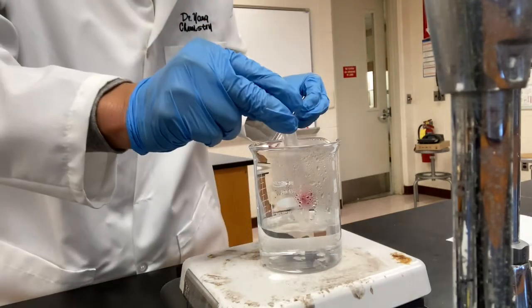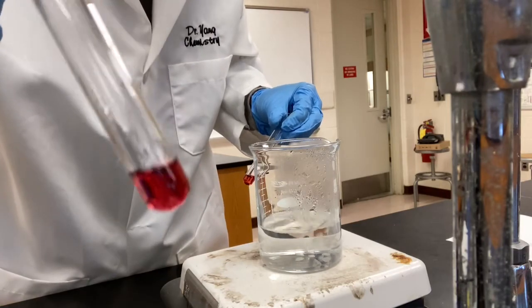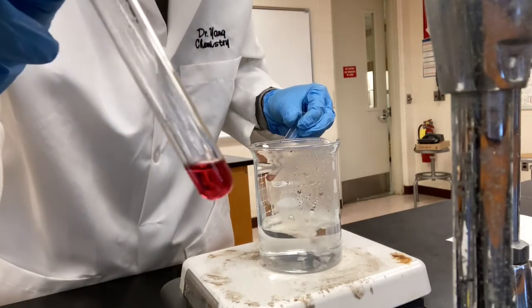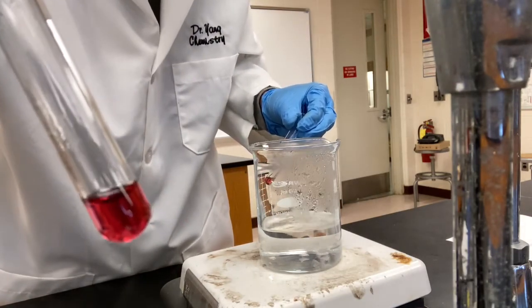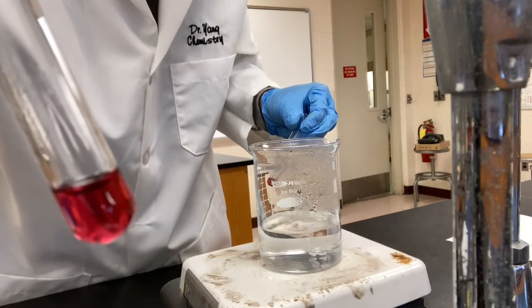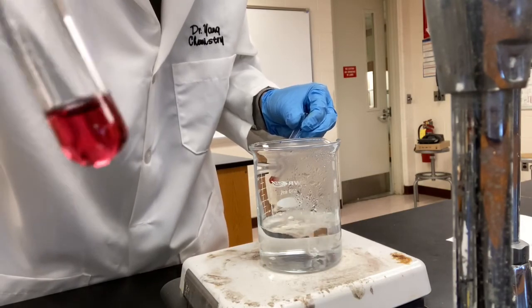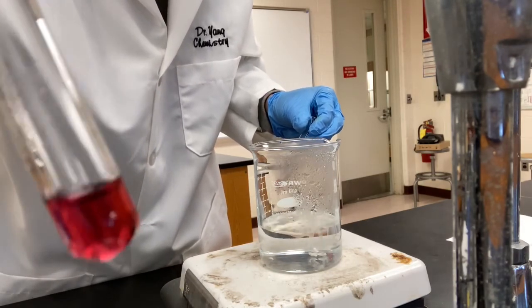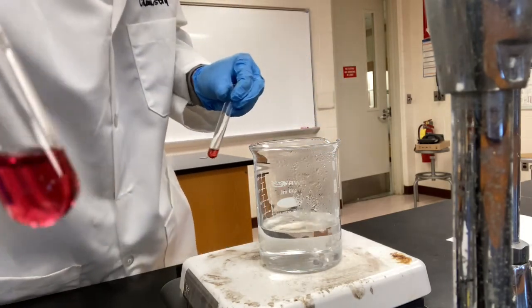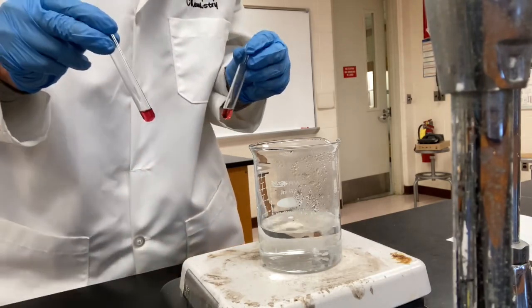Remember, adding energy darkens the mixture. Adding energy darkens the mixture. Based on that, you can predict the direction the equilibrium has shifted. Again, remember, the equilibrium will shift away from the added component, in this case, energy. Okay, predict whether it is endothermic or exothermic. All right, that's all for today.